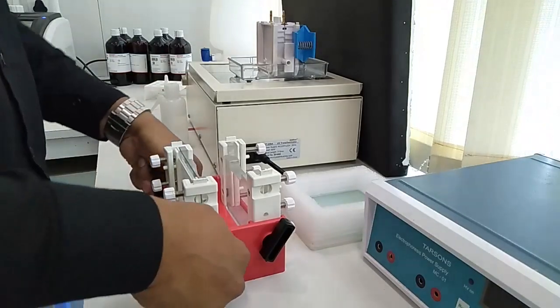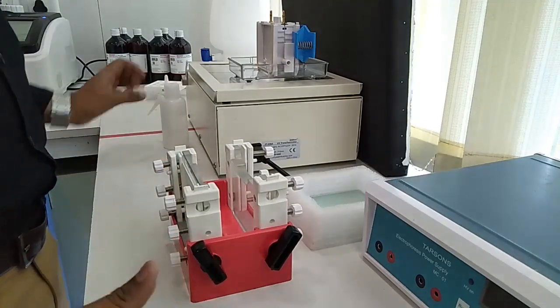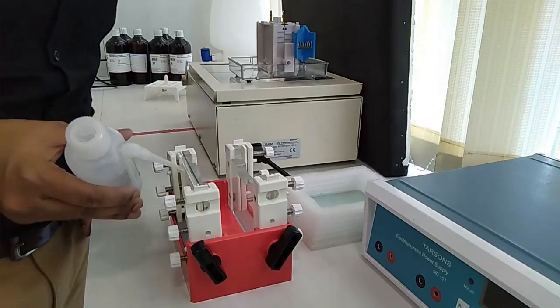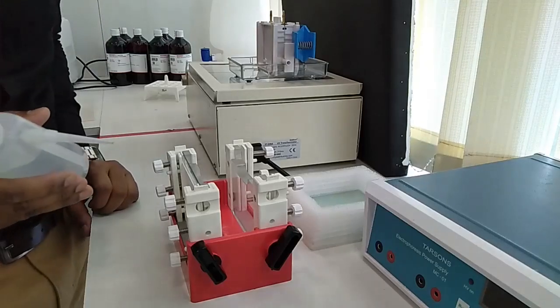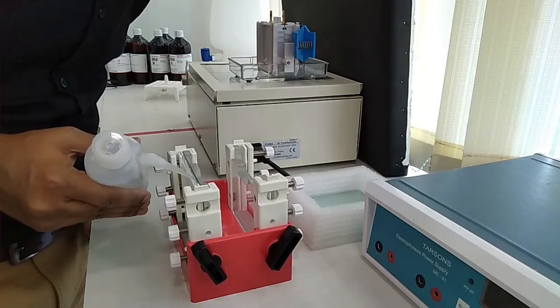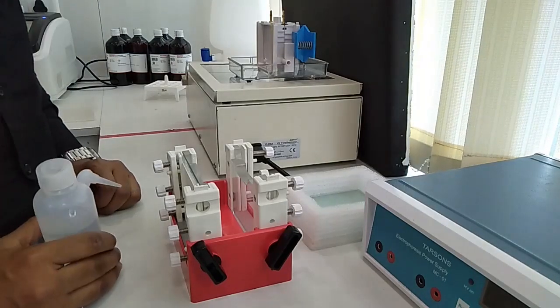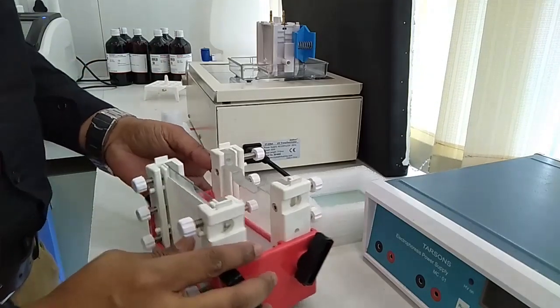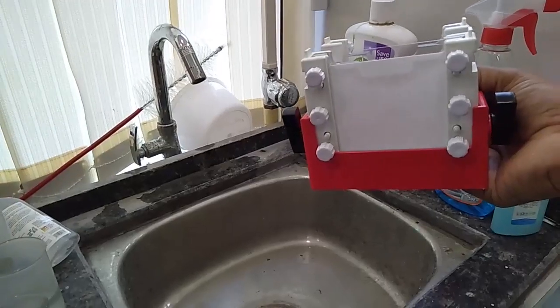I have to tighten the clamps and have to make sure that there is any leak or not. So insert some water into it.